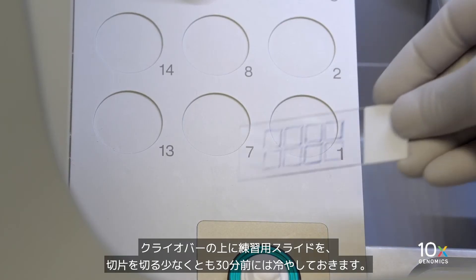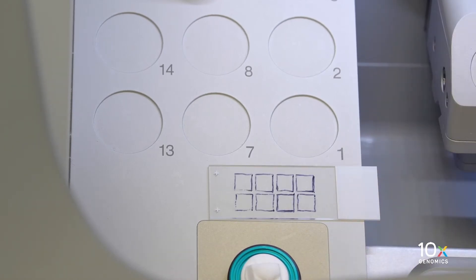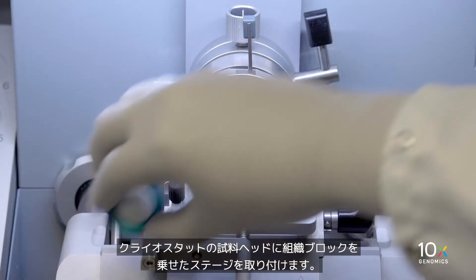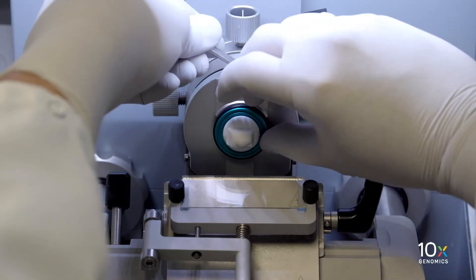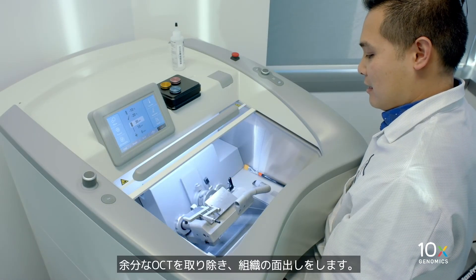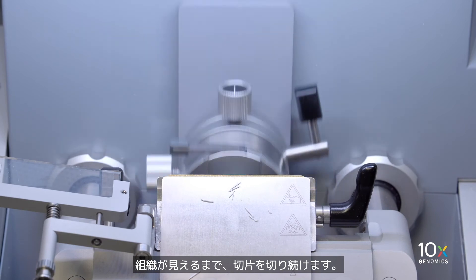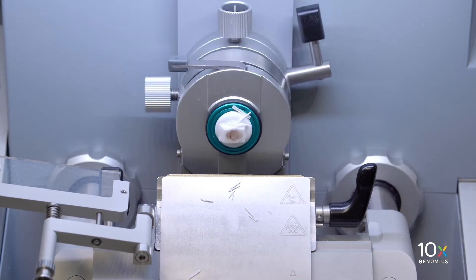Cool the practice slide on the cryobar for at least 30 minutes prior to sectioning. We are ready to cryo section our OCT embedded tissue block. Install the stage with the tissue block onto the specimen head of the cryostat. Remove the excess OCT and expose the tissue. Continue sectioning until the tissue is visible. Next, we will practice section placement on a plain glass slide.